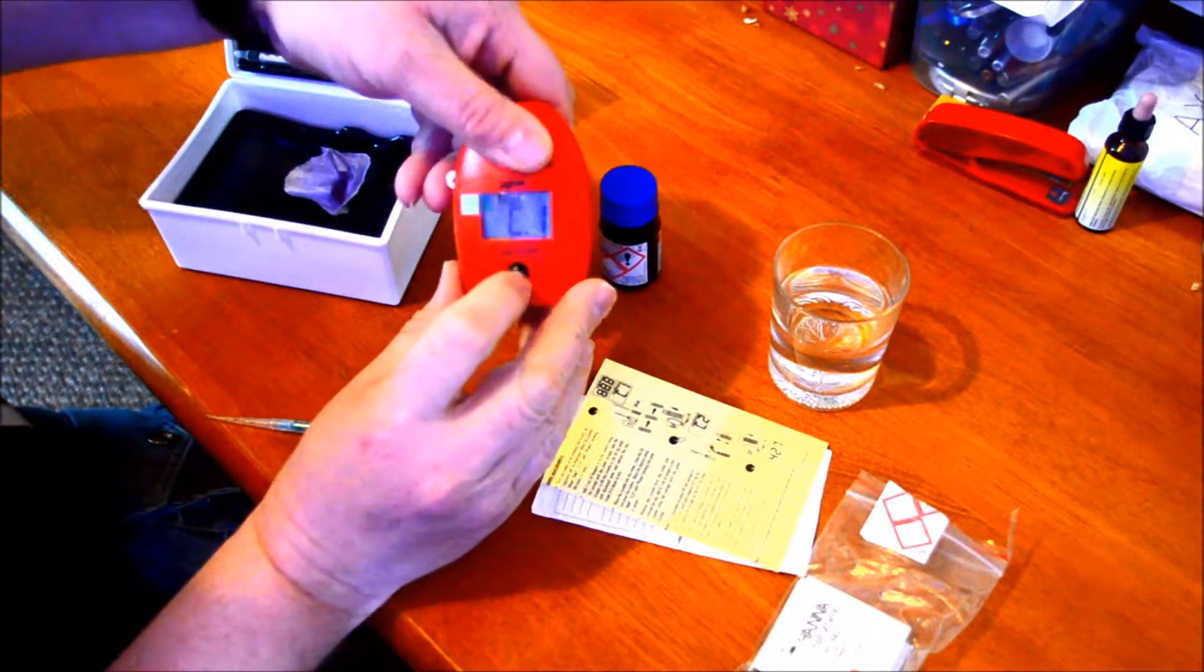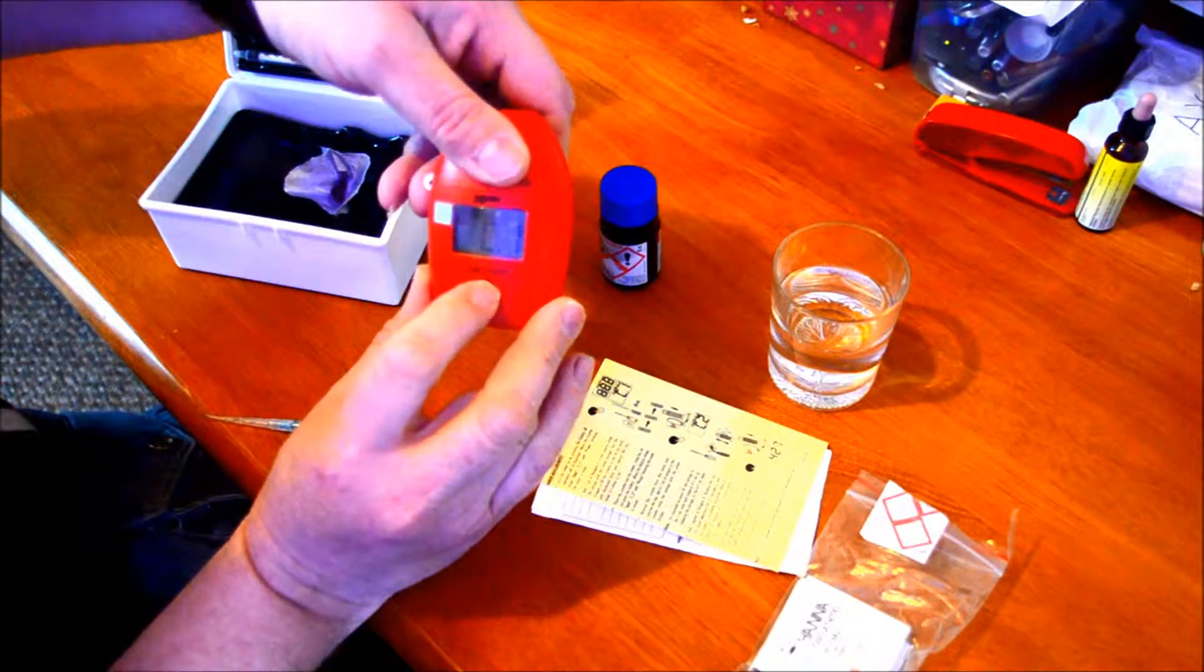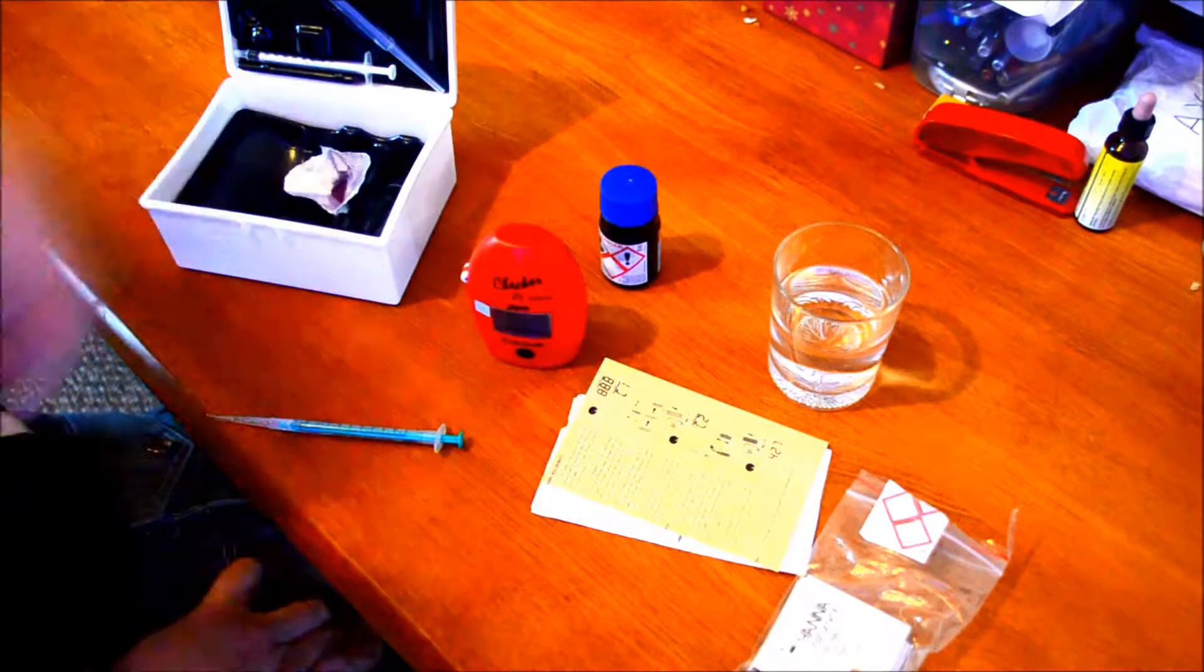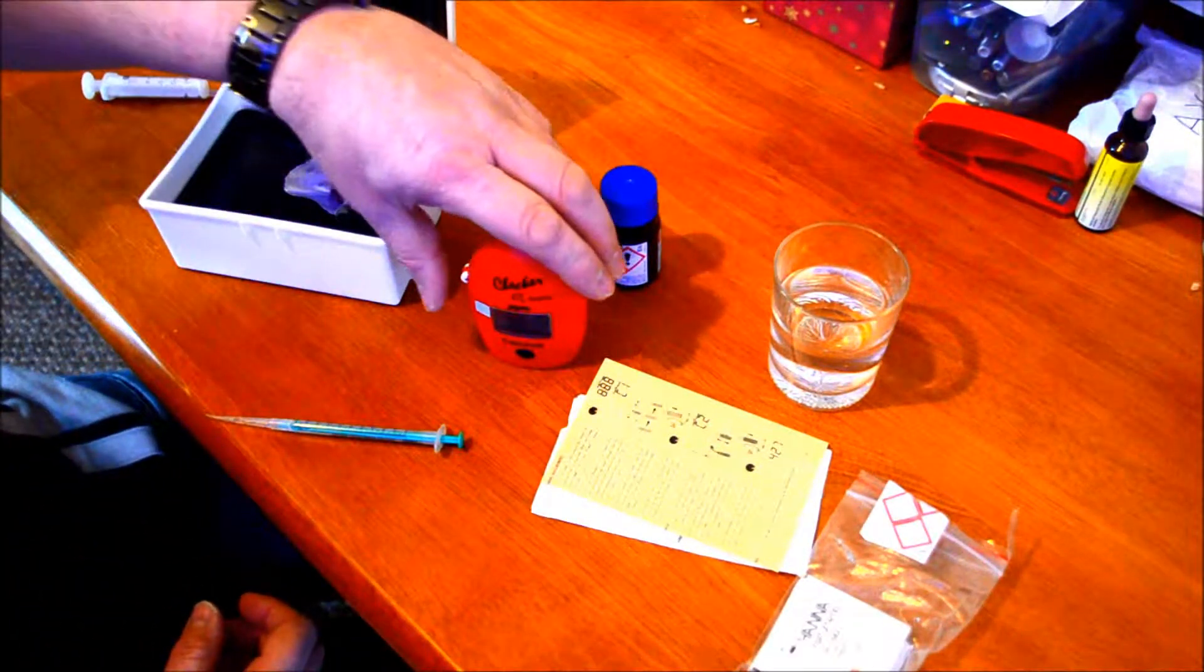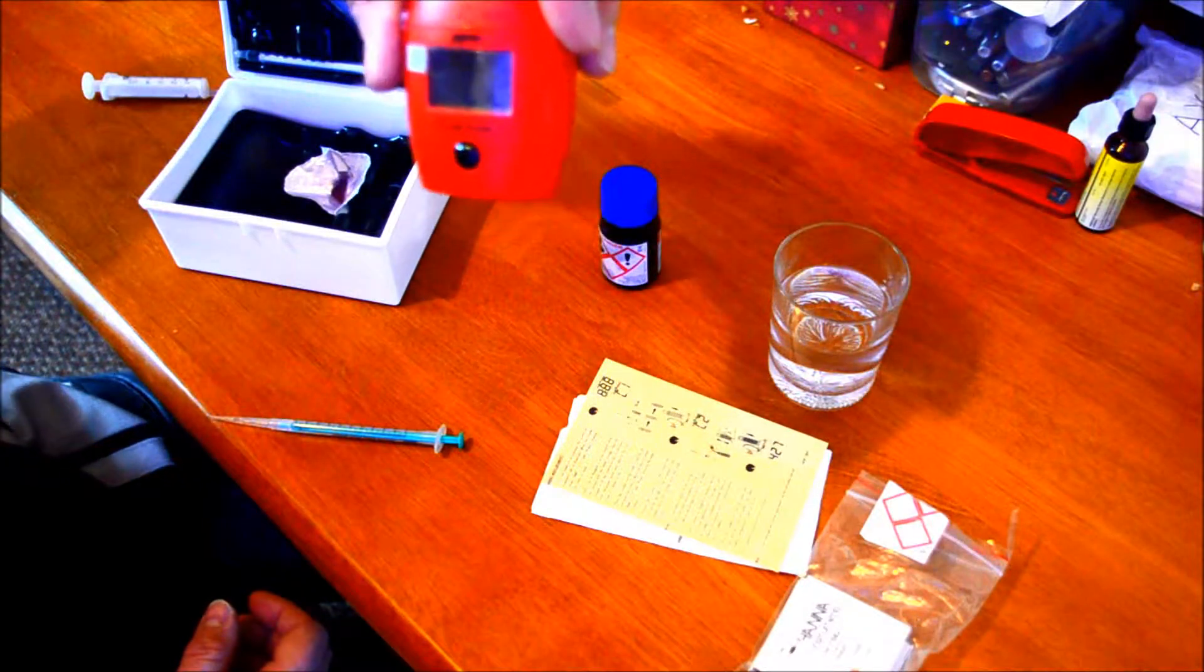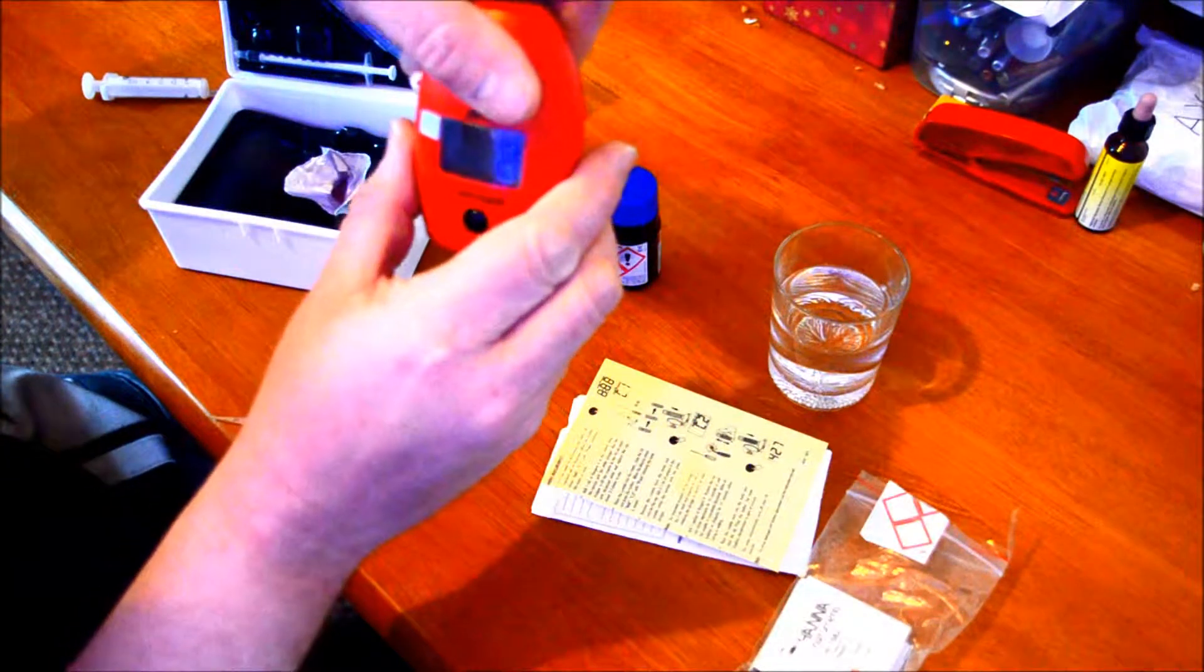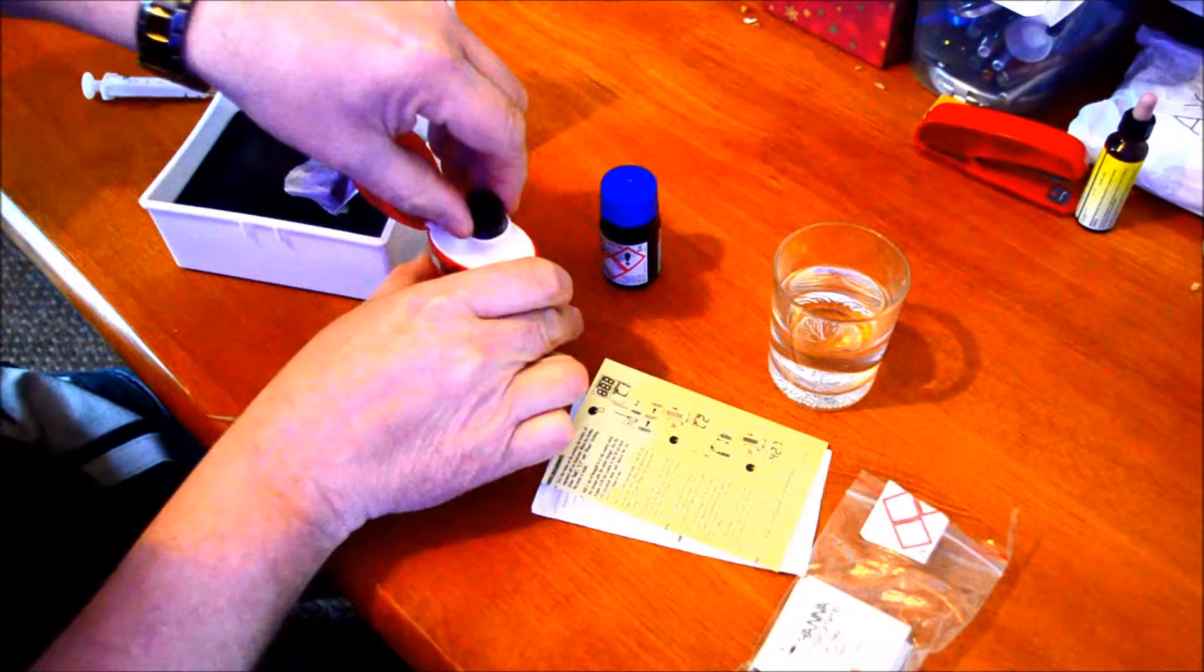Put it in the checker at C1 and press it. It starts to work things out. This is just calibration. Then C2, you take it back out.